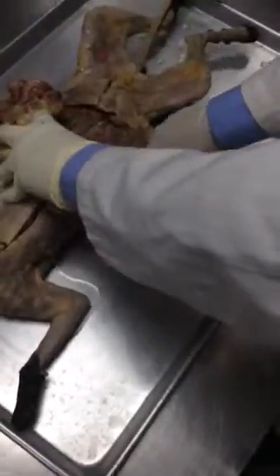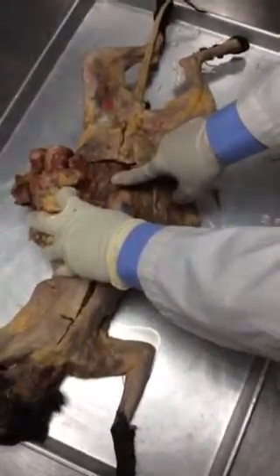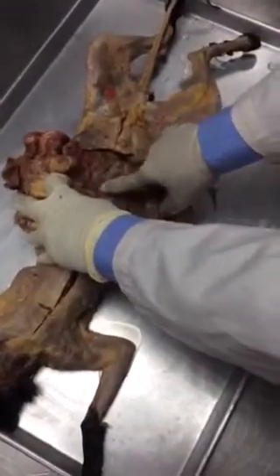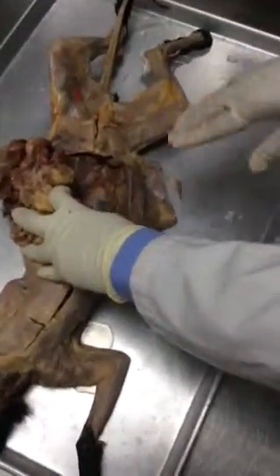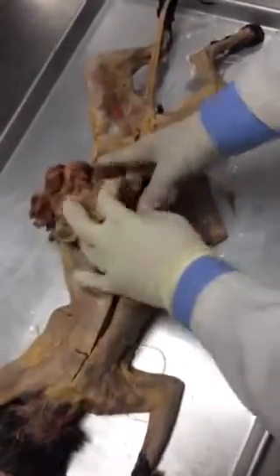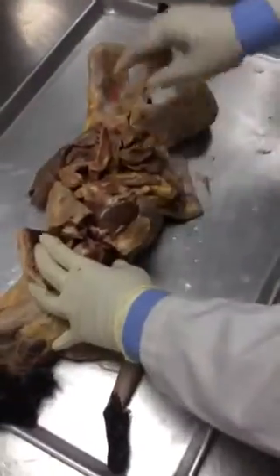So this is the other kidney, okay? And this blood vessel, what is that called? The blue one? Inferior vena cava, not the artery, blue. And the artery should be right next to it in red, okay? So next time we are gonna dissect the kidneys, we're gonna see the ureters and other things, alright? So today, just intestine and the thorax, okay? Because you need to dissect it more.